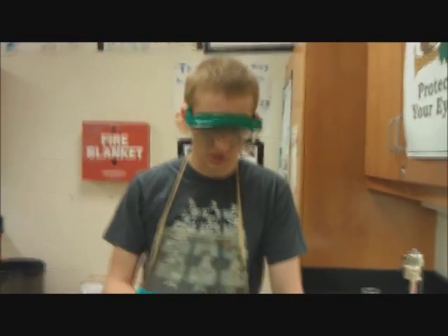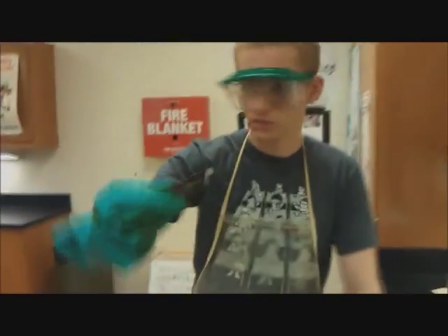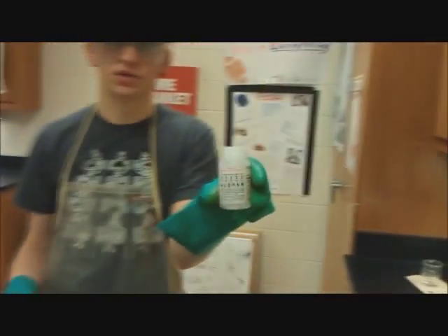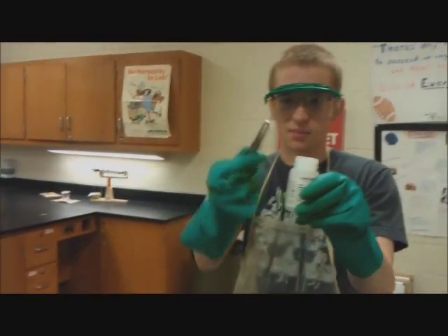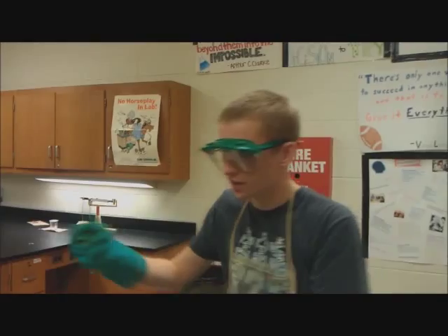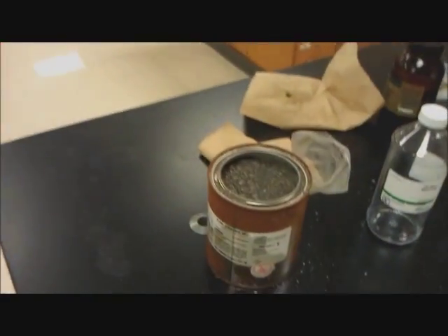This reaction will do the same thing with potassium except it's sodium. So we have some sodium metal here. Straight threes across the board — extremely dangerous. This is inside a bottle, inside kerosene, inside of a bag. That bag is inside a container full of clay, and that clay is inside of a tin. So you don't mess with this stuff — it's pretty serious.